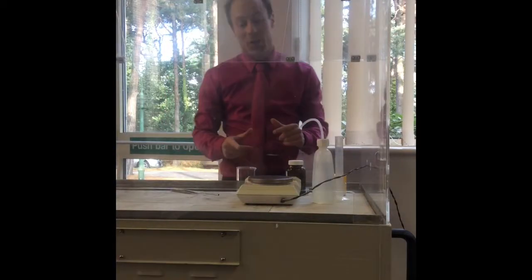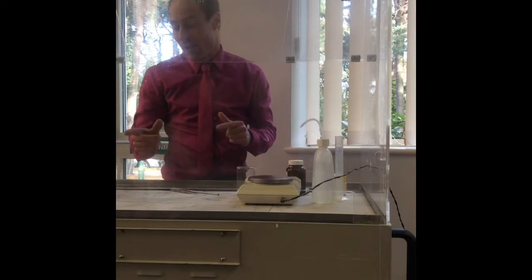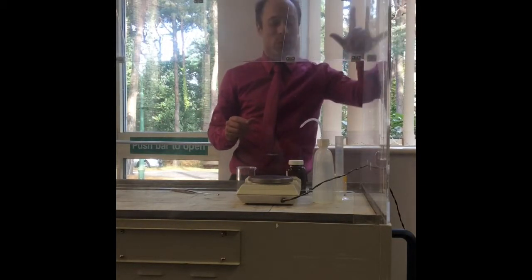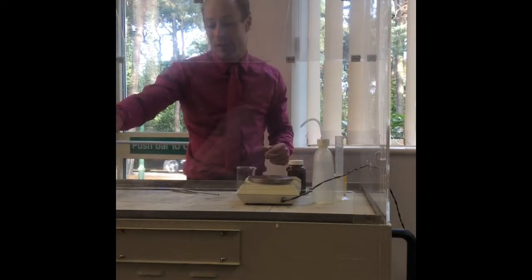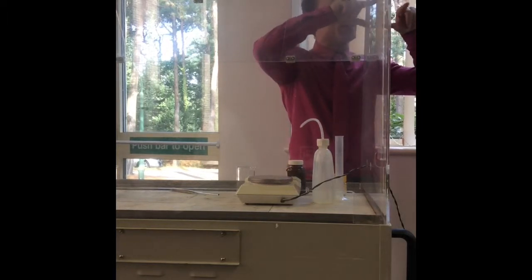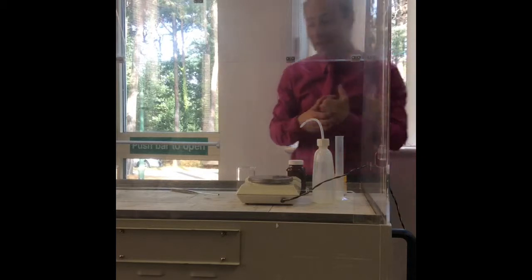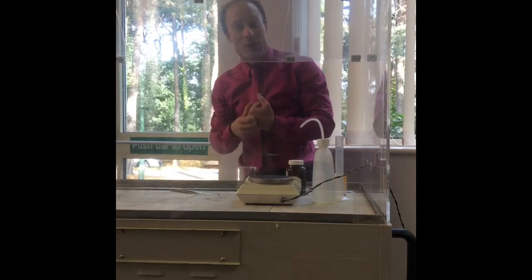Okay, so the idea is we're going to make a polyamide, which is going to be nylon. But we would, as I said, use a dicarboxylic acid, which we're not going to do. We're going to use an acid chloride. So if you look at the molecule on the board, rather than having OH groups coming off of it, you've got chlorines coming off of it instead. And we'll think about how that affects it as we do the practical.